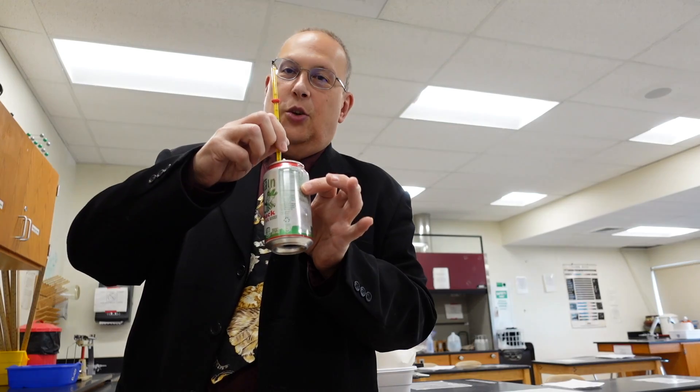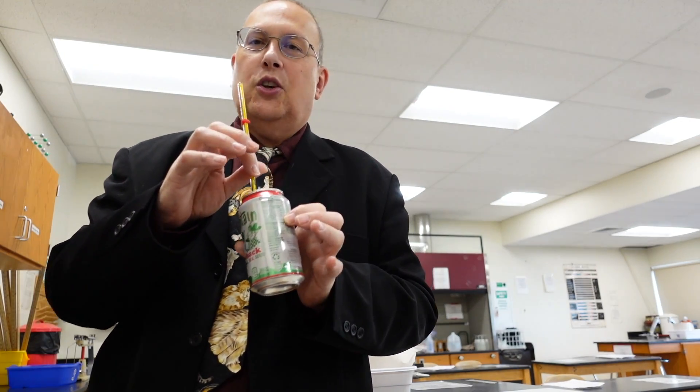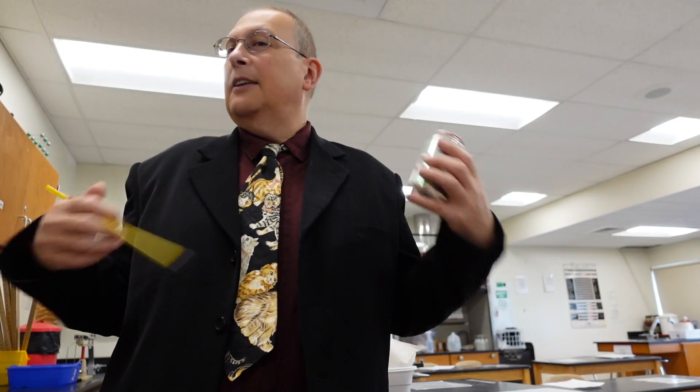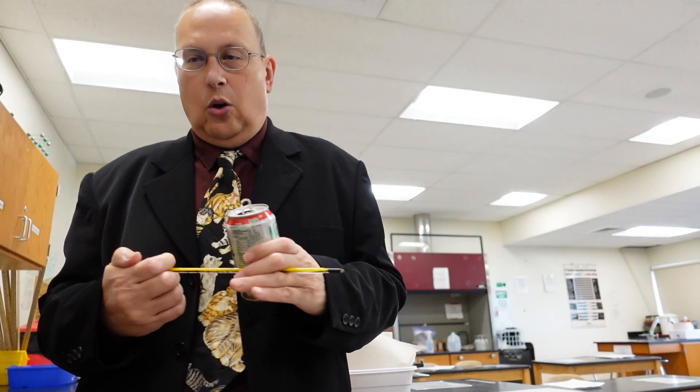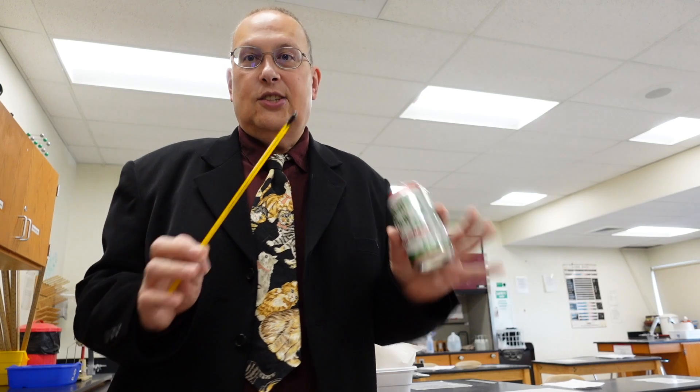And then we're going to suspend the can with a thermometer suspended into it and record the temperature before we light the candle. We're going to let the candle burn for 10 minutes because it doesn't generate a huge amount of heat and water does heat up very slowly, so we have to give it plenty of time in order for this to work. So let's get started.